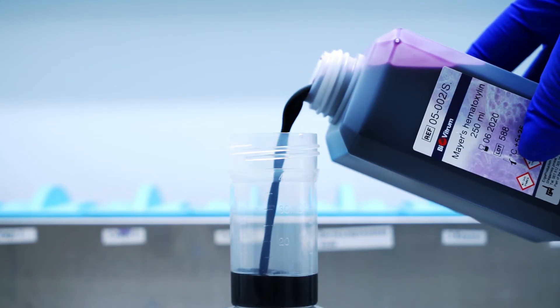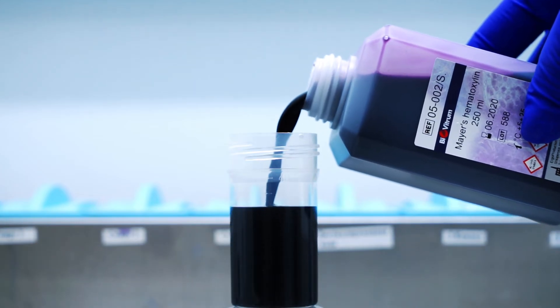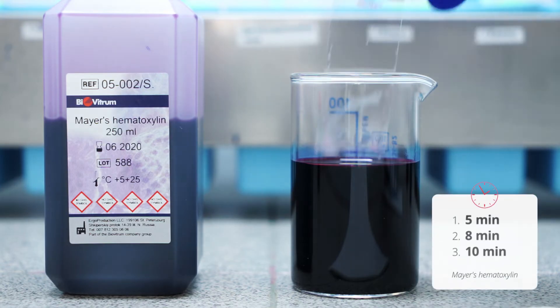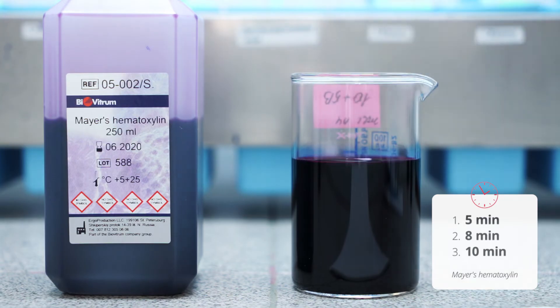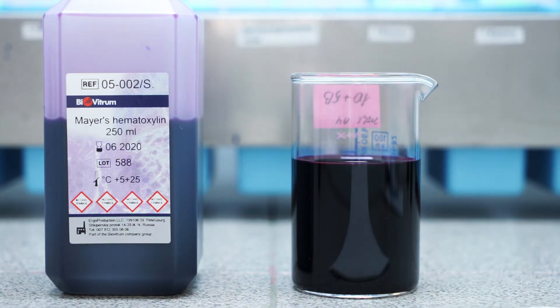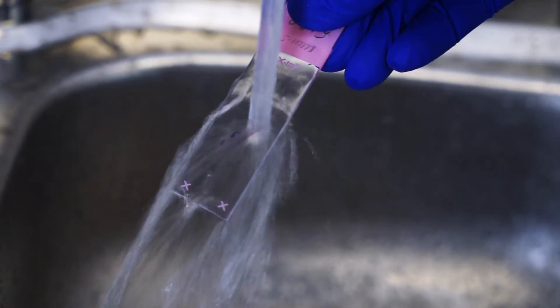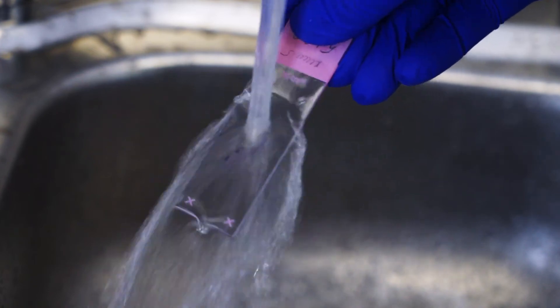After that we stain the slides with hematoxylin. We use Mayer's hematoxylin and the exposition times are 5, 8 and 10 minutes respectively. Then we wash the slides in tap water.